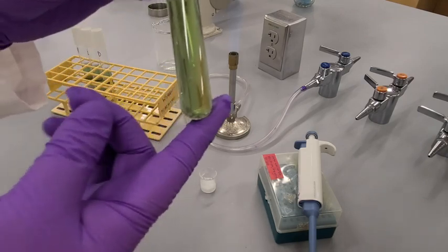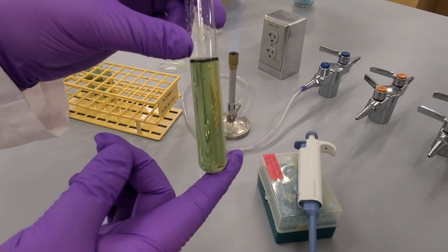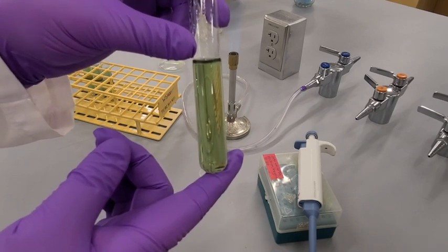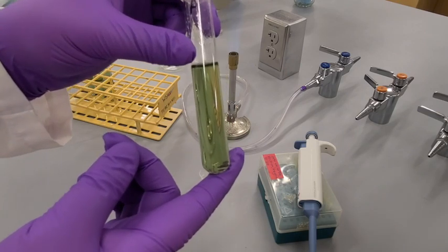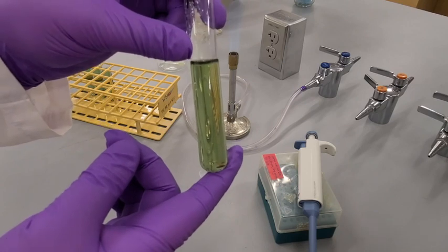The media is a solid agar so that once it cools it will solidify. Right now it's liquid.